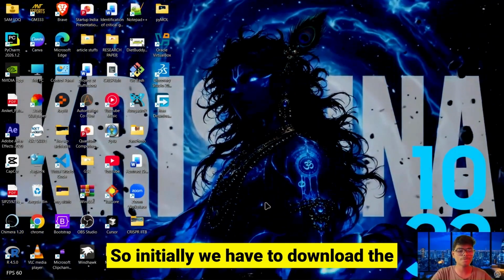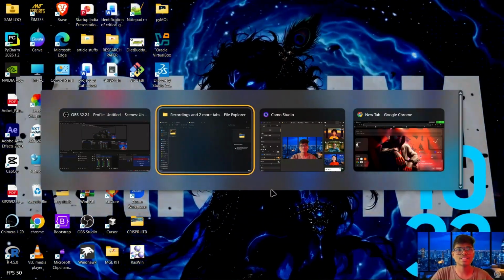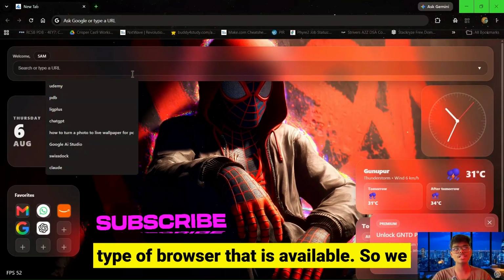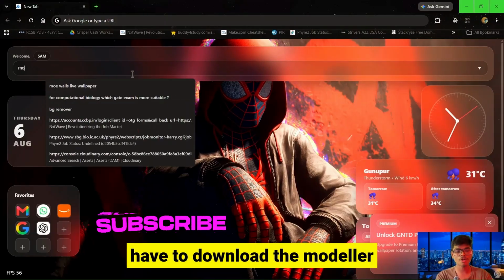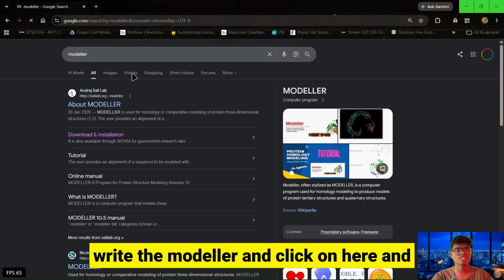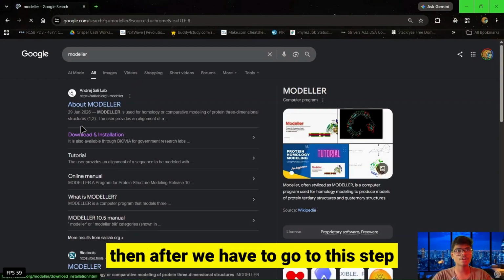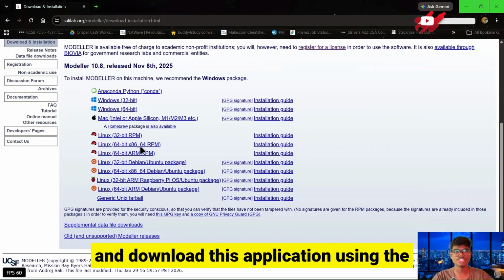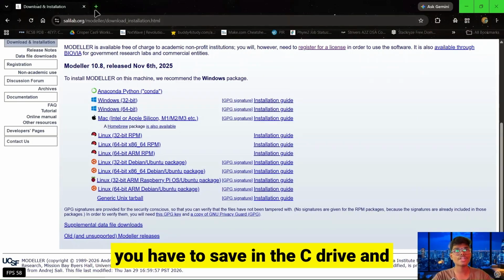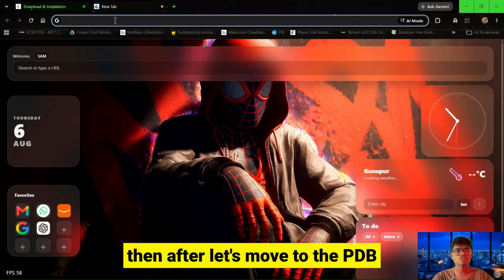Initially we have to download the protein structure, so let's move to Google Chrome or any type of browser that is available. We have to download the Modeller application. For that we have to search for Modeller and click here, and then go to this step and download this application using the browser. After downloading and choosing the requirements in the application, you have to save it in the C drive, and then let's move to the PDB database.